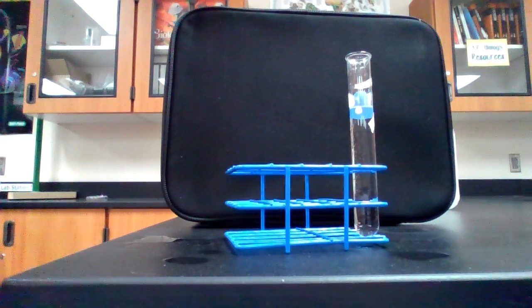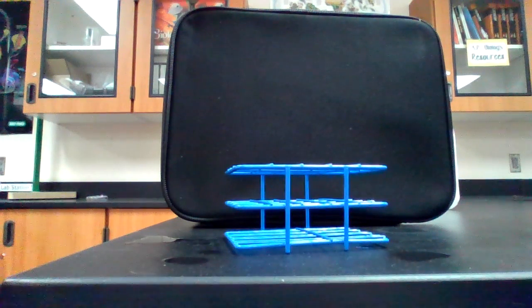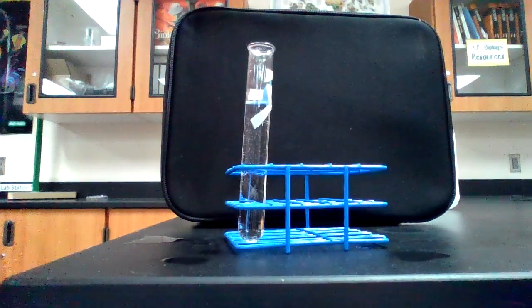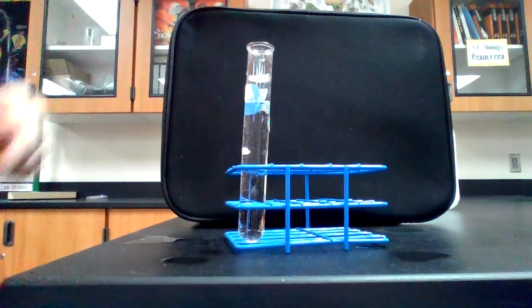It's a little bizarre, folks. I'm not going to lie. It's not what we expected to see. That's all right. We will keep going. I'm trying to catch that bead and take it out of there. So hang on one second. And it is proving difficult to catch. There we go. All right, trial 3 for room temperature. Ready, set, go.